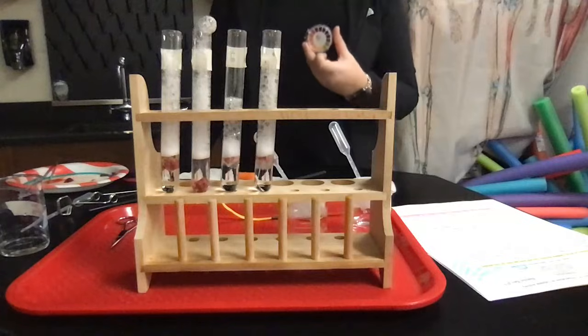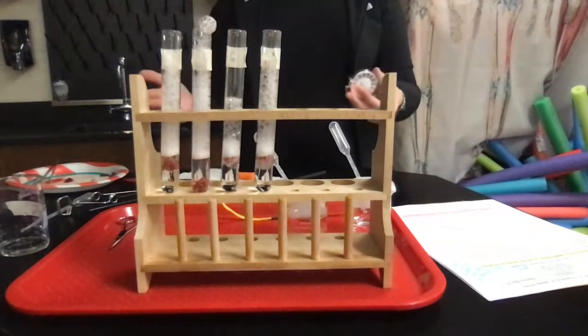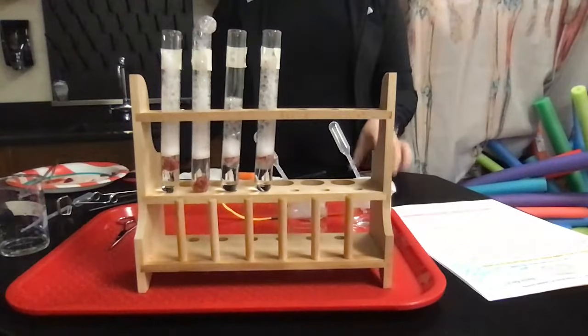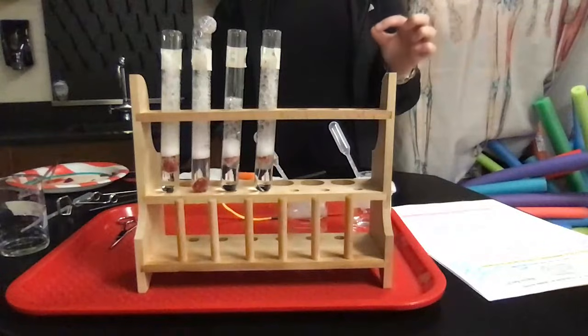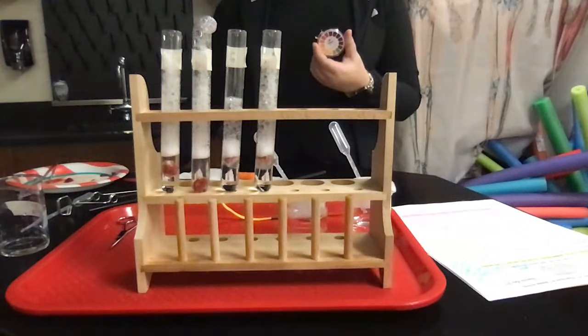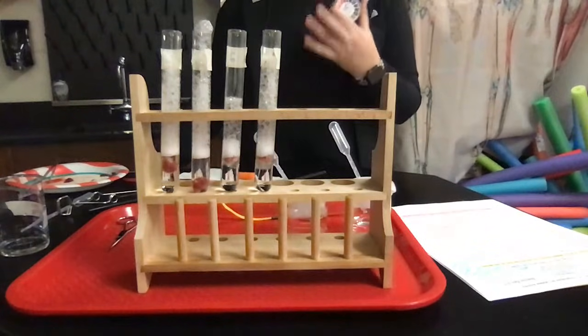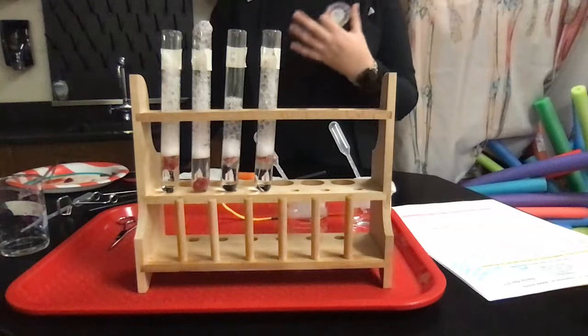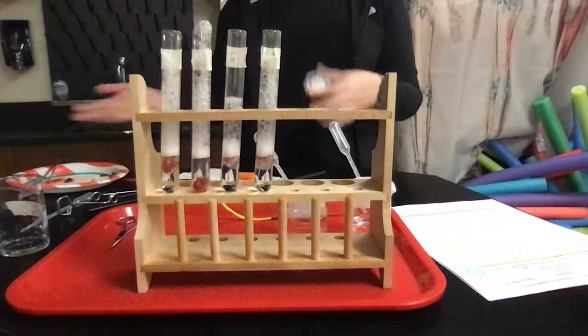Catalase is a pretty friendly enzyme. That's why we use it in a lab like this, so you still get to see results. But there are some that, if you're off even by a couple of degrees or 1 or 2 pH levels, then it's not going to function at all. But here we did see functionality, but obviously the optimal functionality was exactly what we would expect, having it be from a liver from a mammal, right? Okay, so I hope that makes sense.